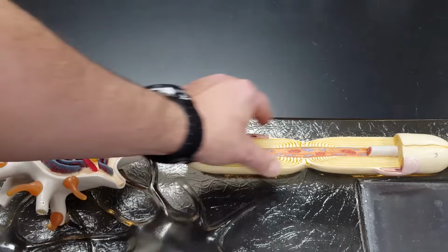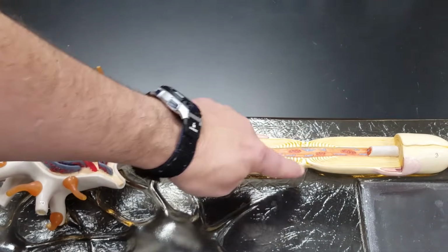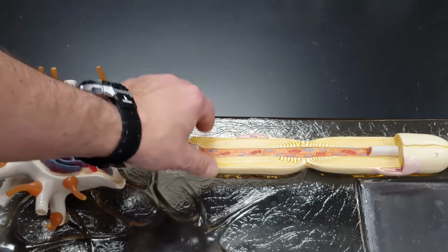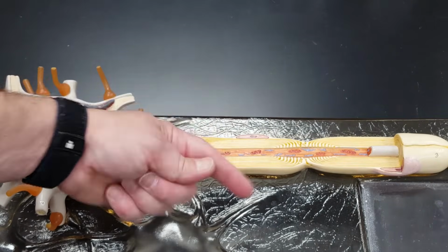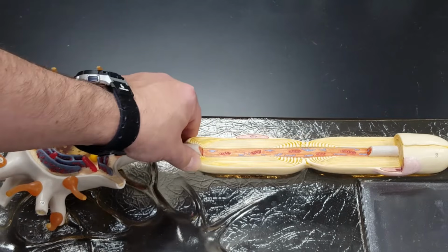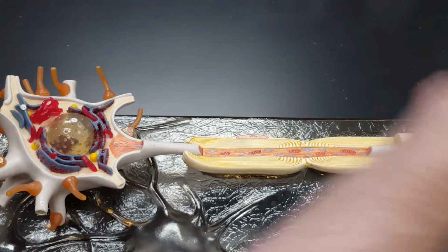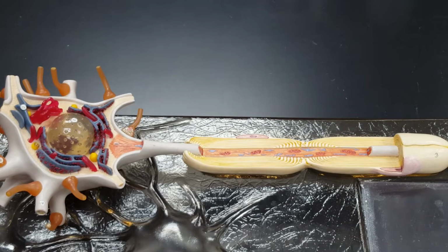This thing right here, from here to here, is a Schwann cell. The cell that wraps around and around and around the axon to, in effect, in a biological sense, insulate the wire so the action potential can go down this thing using saltatory conduction. Again, getting a little lectury on you sometimes is hard, sorry. But this cell is what's called a Schwann cell. Look for that on your list.